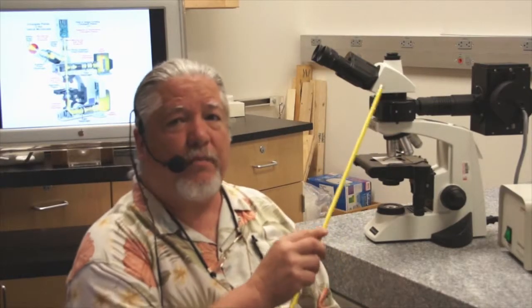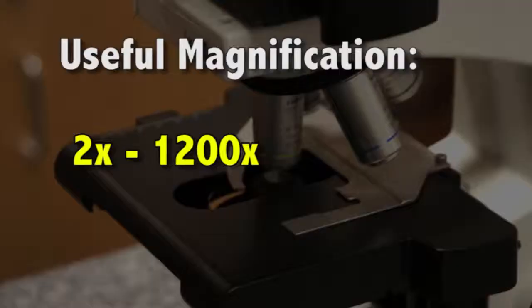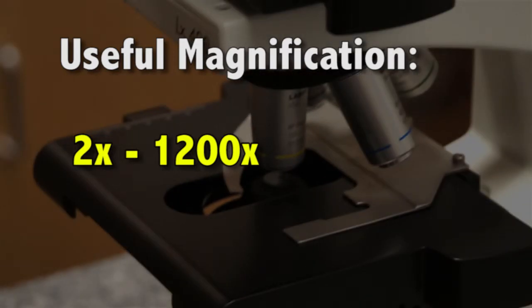Ergo, this is a compound microscope, and there are other features that we're going to discuss as we go along. Useful magnification for an instrument like this is about 2 power up to maybe 1200 power. You really can't go any higher than that and still maintain the resolution that you're looking for in a microscope.